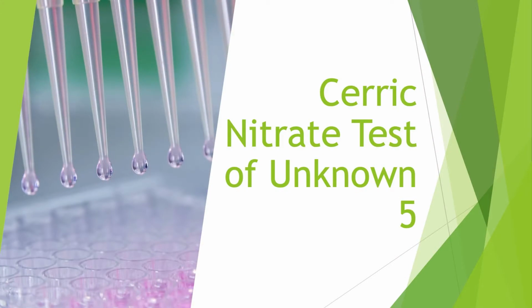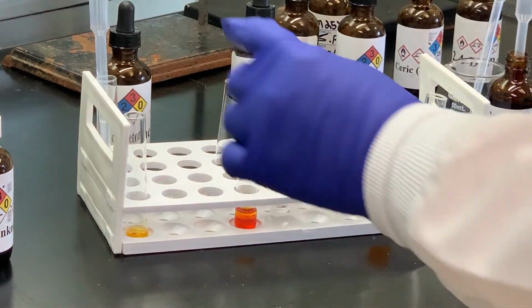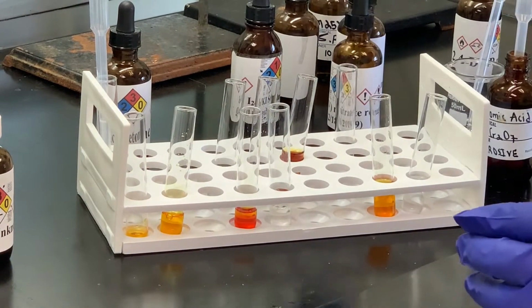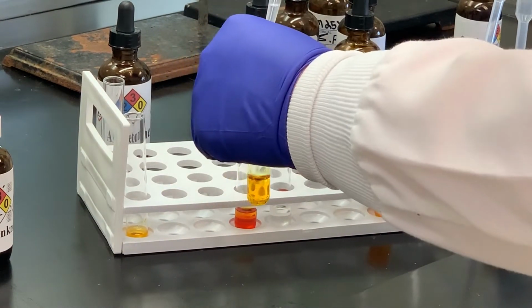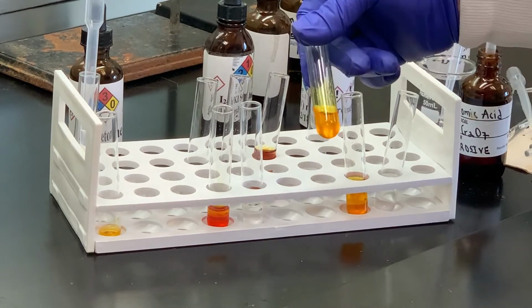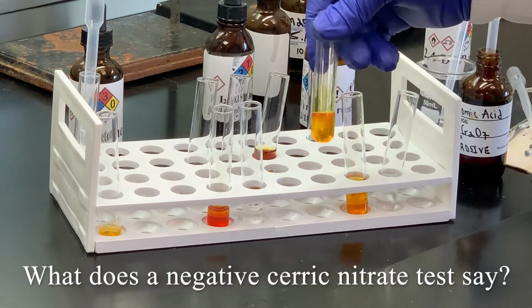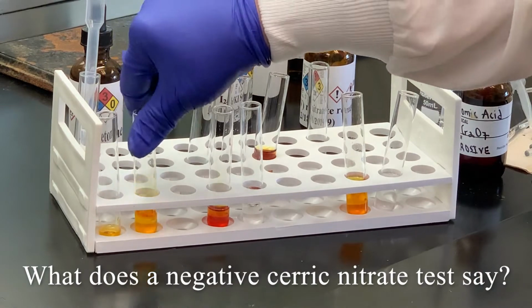First thing we're going to do is test our unknown with the ceric nitrate solution. Here's our blank. I'm going to put some ceric nitrate into that test tube, and then we'll add a few drops of our unknown. Swirl that pretty good. We could get 2 layers, but unless something has a drastic color change, we're going to consider that negative. I'm not seeing anything too drastic. A little bit of a tint, but it should be kind of a bright red color. So I'm going to consider that negative.